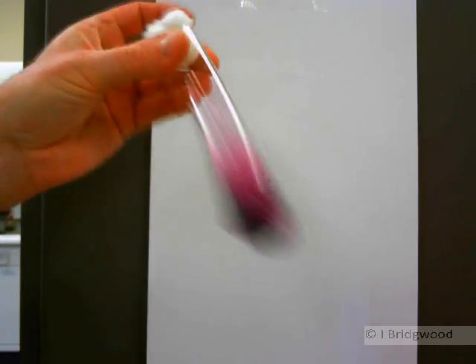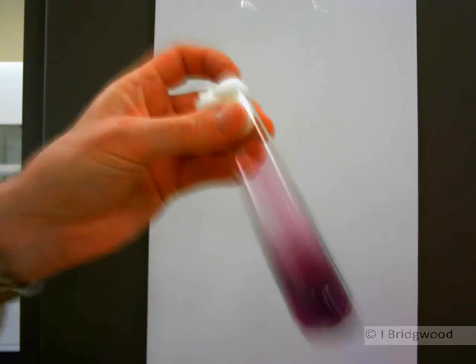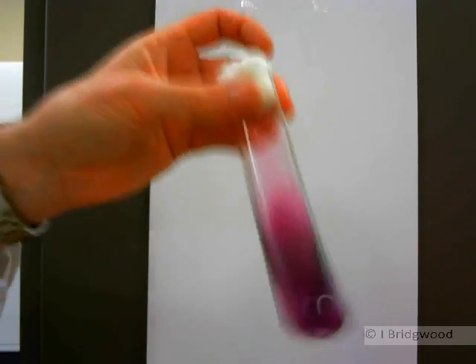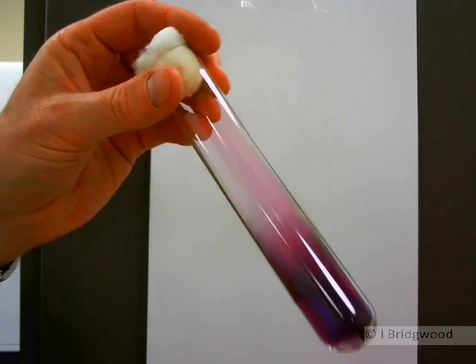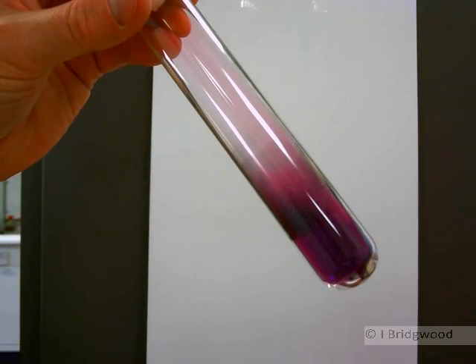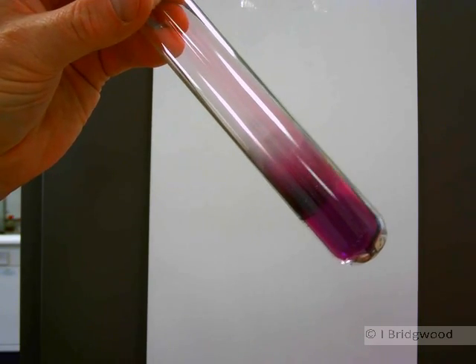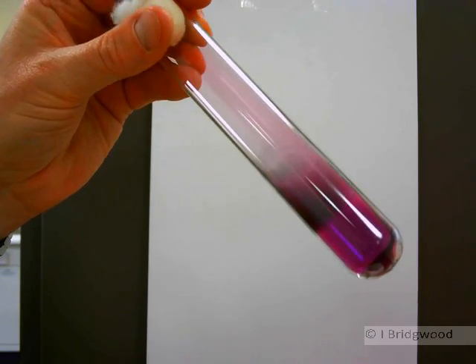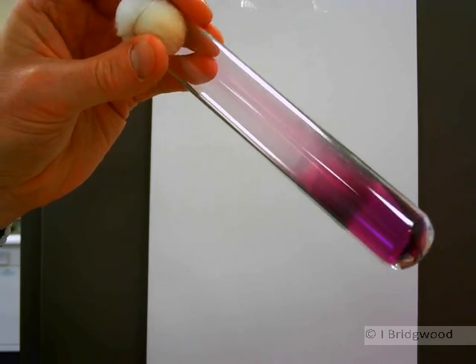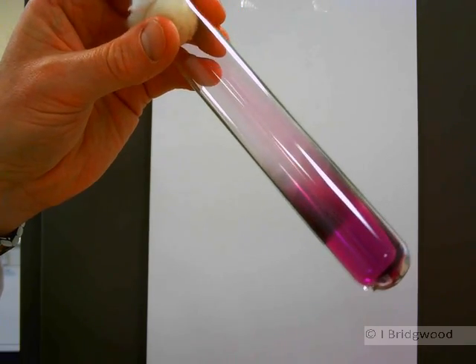So it does actually, or at least some of it, move to the liquid phase. Having said that, when it condenses, you can probably see there's the vapor, but you may be able to just see a little bit of twinkling on the surface of the glass where some of the vapor has cooled and condensed onto the cool surface of the glass.